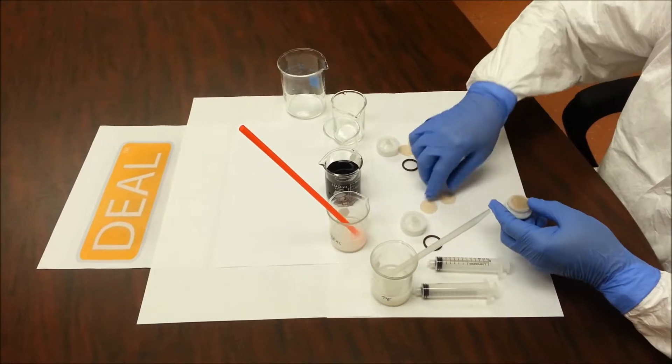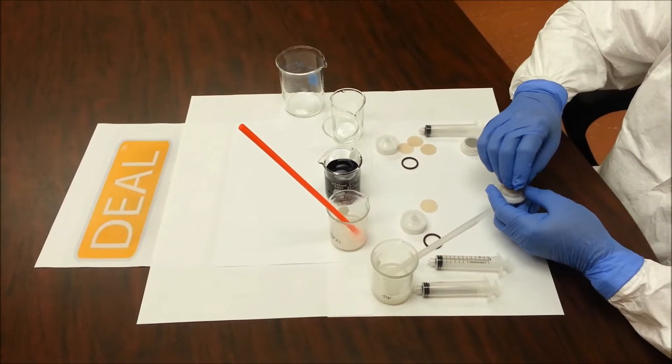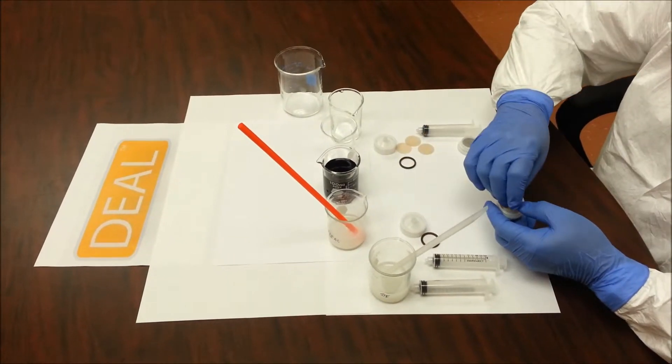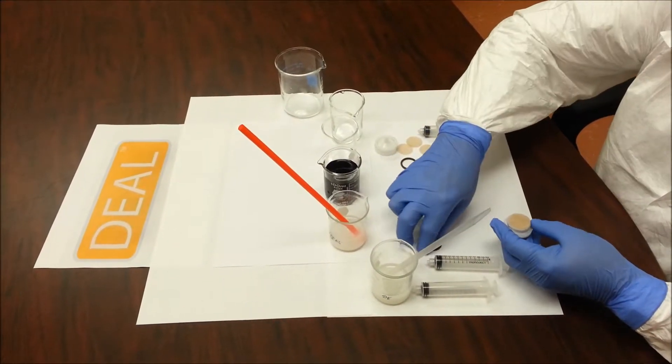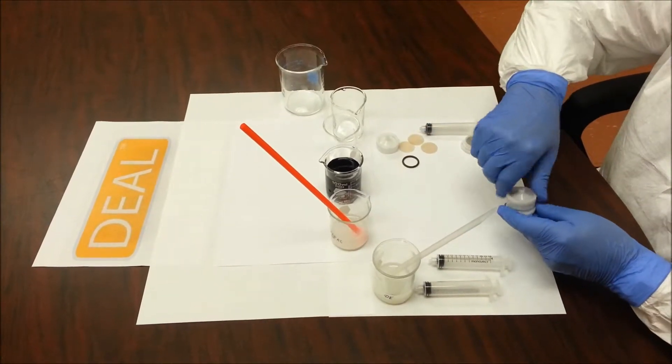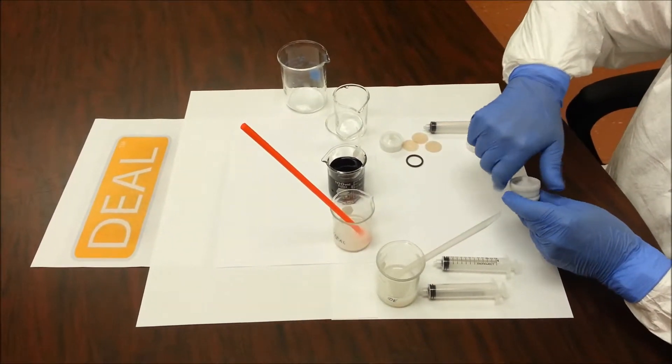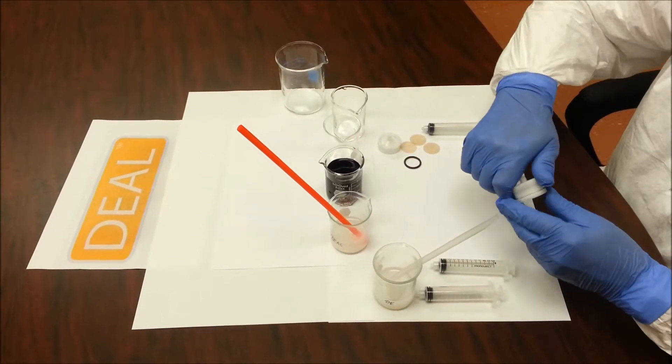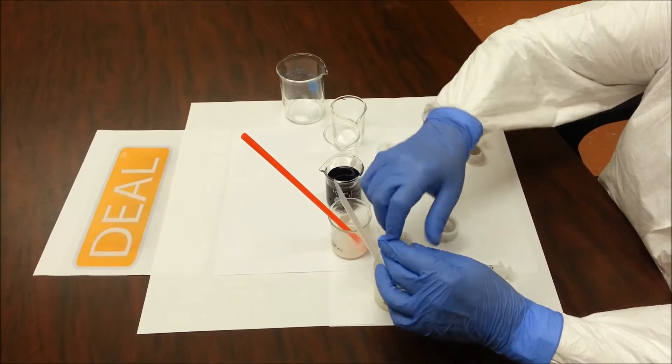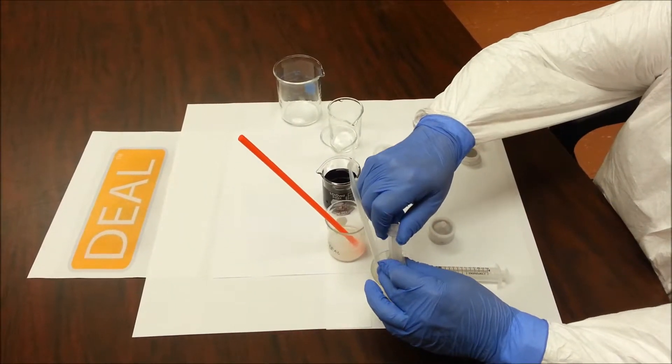Leo first will build up a pre-coat. He's taking 100 nanometer disks and putting them into a 25 millimeter holder. This is diatomaceous earth in solution.